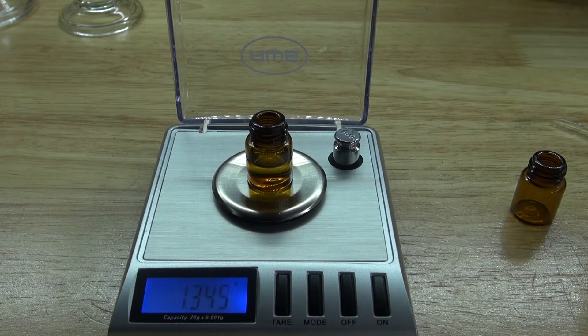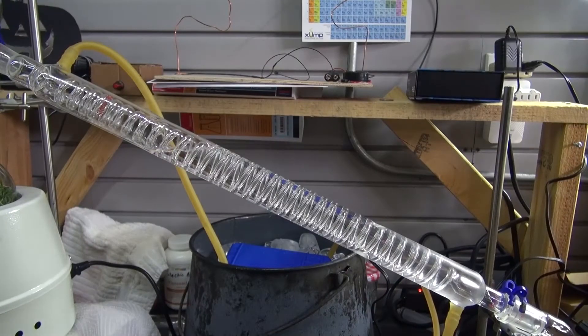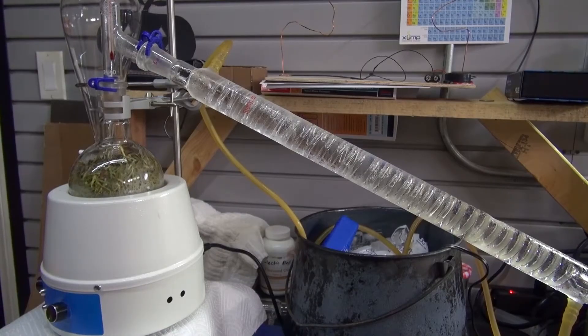Hello and welcome back to Sci-Tai Tech. In this video I'm going to show you how to make rosemary essential oil using fresh rosemary and a chemistry distillation apparatus. Let's get started.